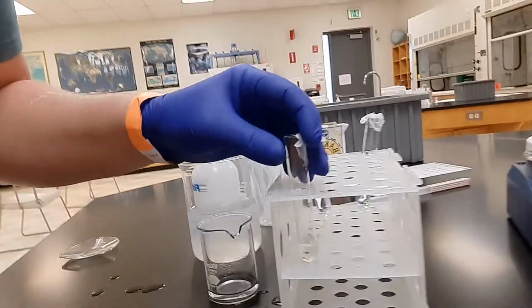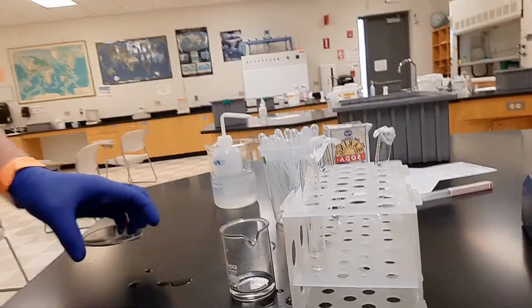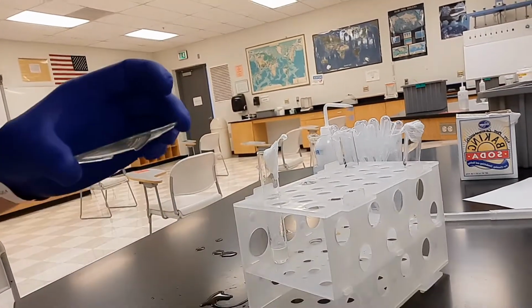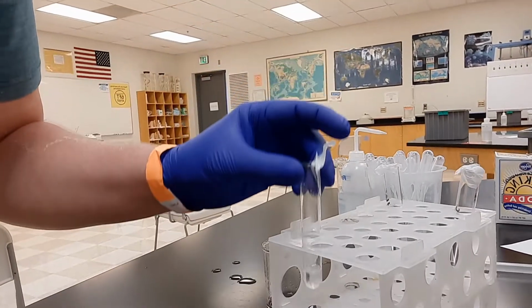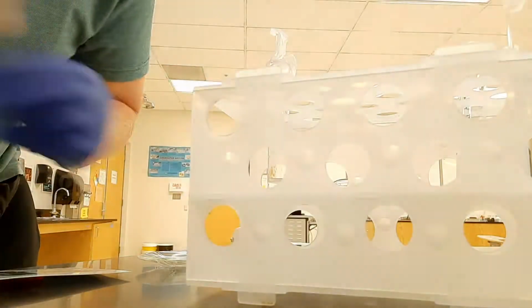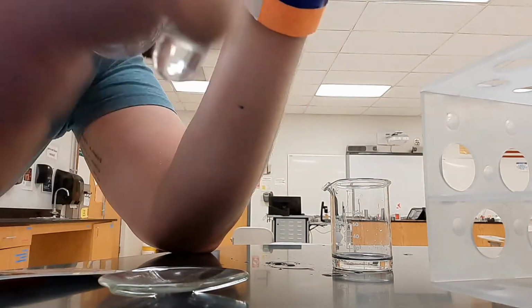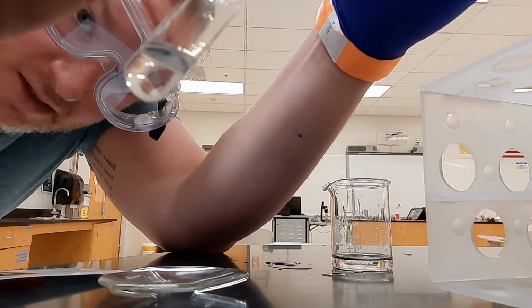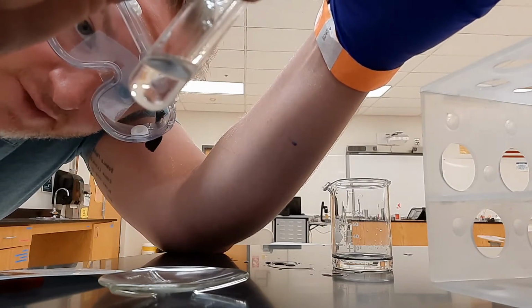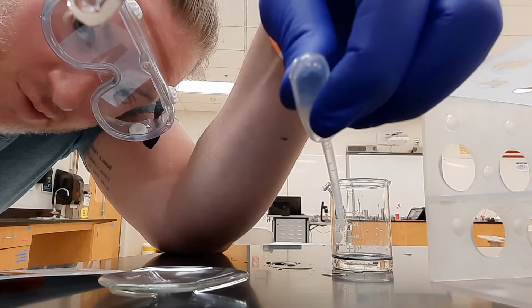This is very careful and just takes some time to play with here. I'm going to get a watch glass and I'm going to try to pipette that top layer off, and only the top layer off, to put on top of the watch glass. So let me see how I can do this, if I can show you what I'm looking at here. I'm going to tilt it to the side, because to the side I kind of have a little more of an edge. And I'm not going to compress this thing completely. I'm only going to give it a little bit of a compress.